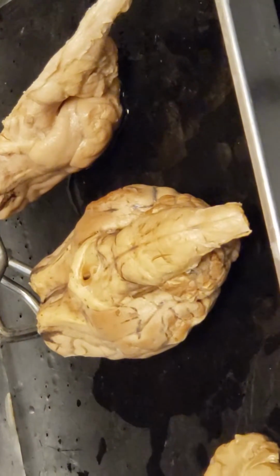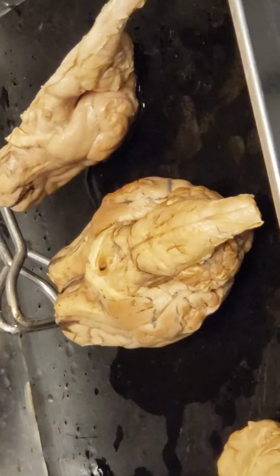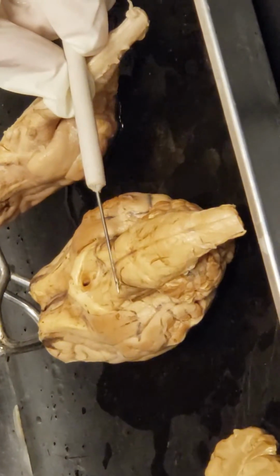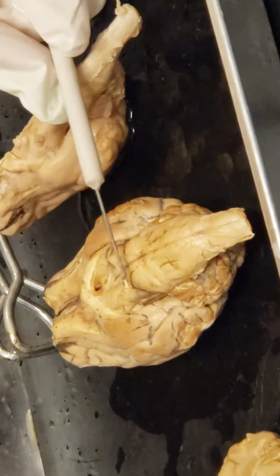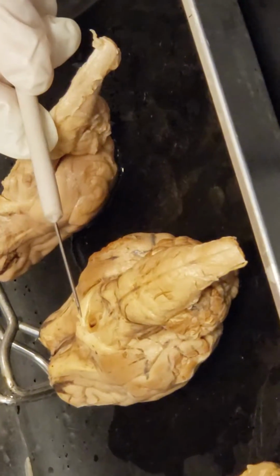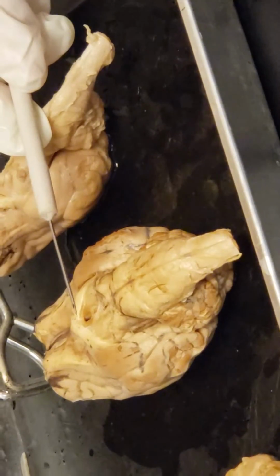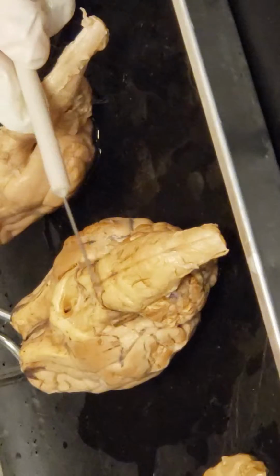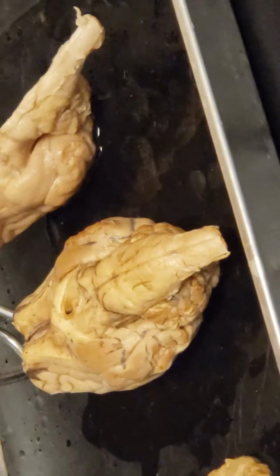The pons. So the pons, in the brainstem, we have the midbrain, and I'll show you the back part of the midbrain here in a second. But remember the pons, I remembered it from the punch out area that you see of the P, that sort of balloonish area, and it kind of balloons up. Do you see it? Because it's subtle. I see it. But a little bit of a bulbular structure there.